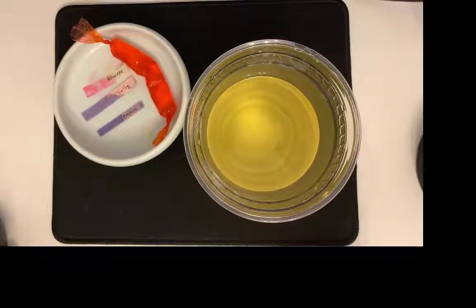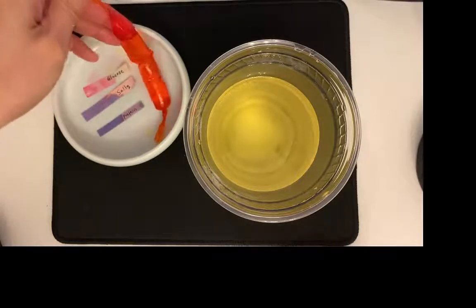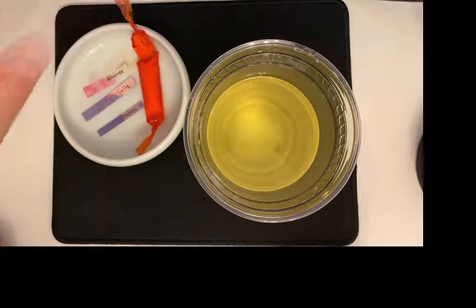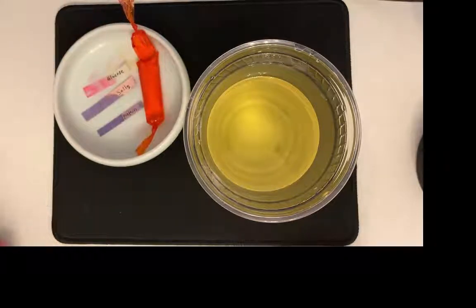Well, I would definitely say there is yellow in there. Is there yellow in the blood? Probably still some, but that one is hard to say. But definitely the urine moved out of the blood into the dialysate.